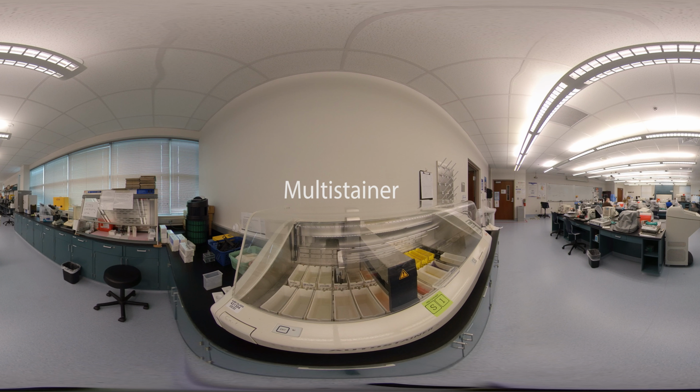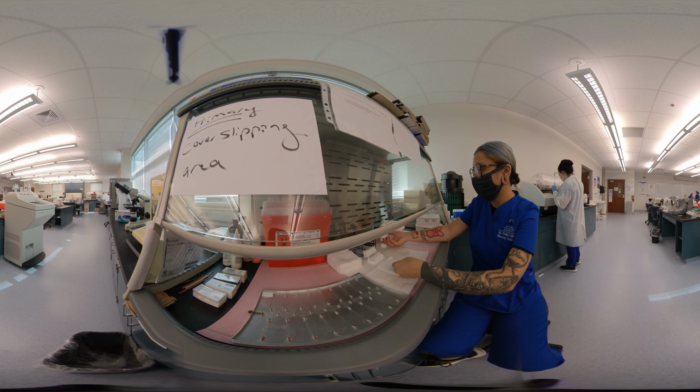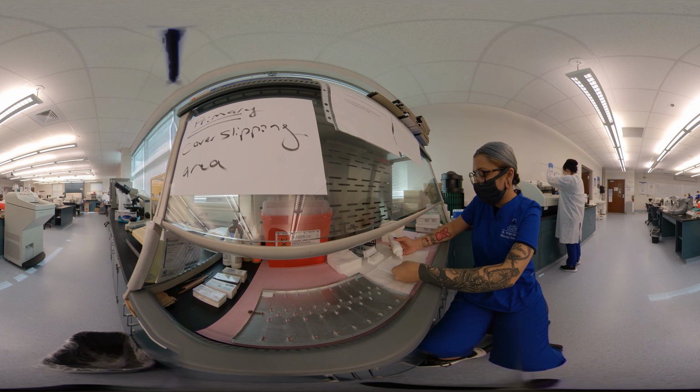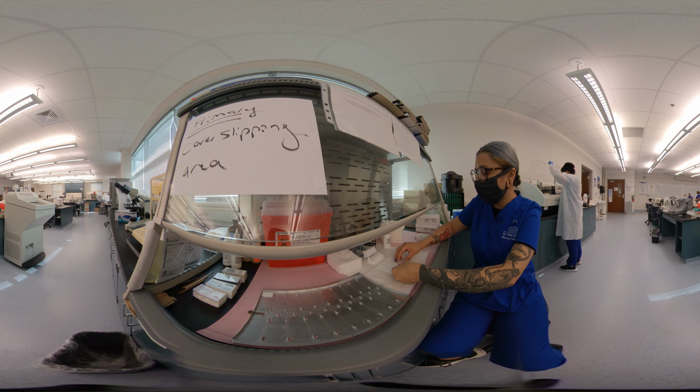As I stated in our previous lesson, staining can be done by hand, but automation is always preferred as results are more consistent from patient to patient. Once the multi-stainer is done, the slides will get cover slipped. The process of cover slipping is taking another piece of glass and placing it on top of the tissue that's on the slide. This preserves the stained tissue and allows the pathologist to see the tissue clearly under the microscope.